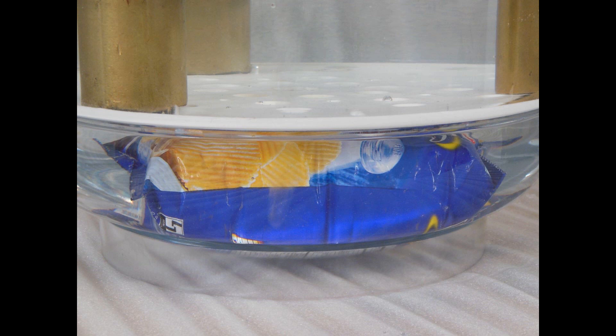You can now open the tank and inspect the pouch. Remember, only a continuous stream of air bubbles means there is a leakage. Sporadic bubbles can come from entrapped air, which is not a leakage.